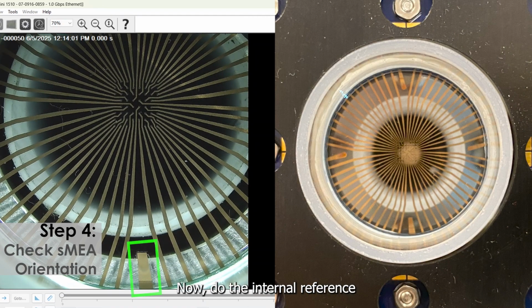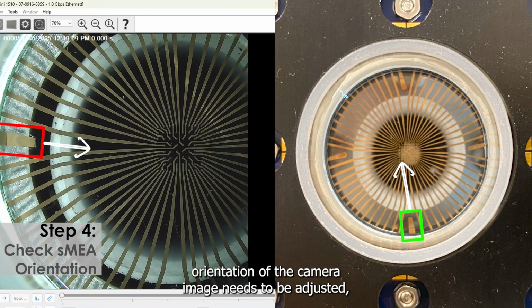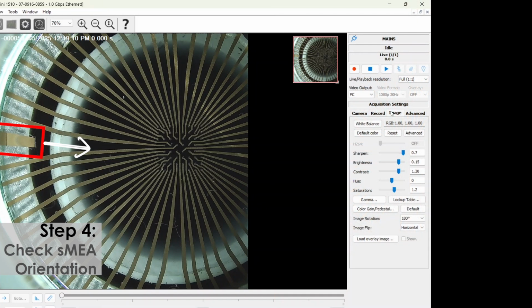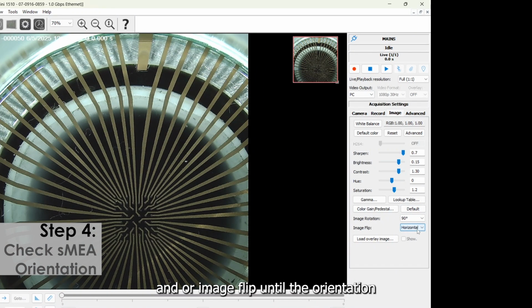Now, do the internal reference electrodes in the camera image match the physical orientation of the sMEA in the platform? If the orientation of the camera image needs to be adjusted, under the Image tab, select the corresponding image rotation and/or image flip until the orientation matches.